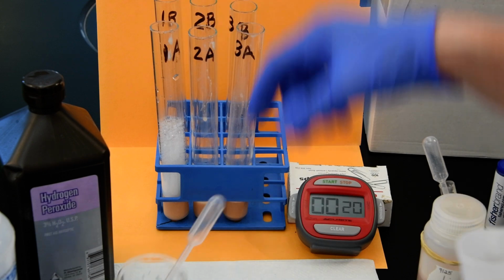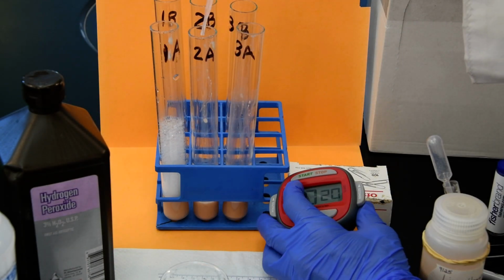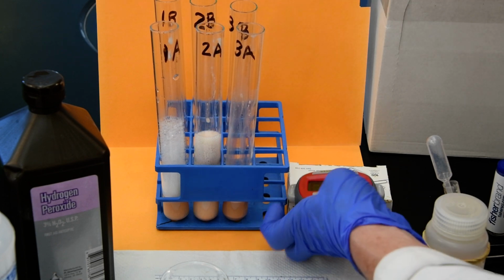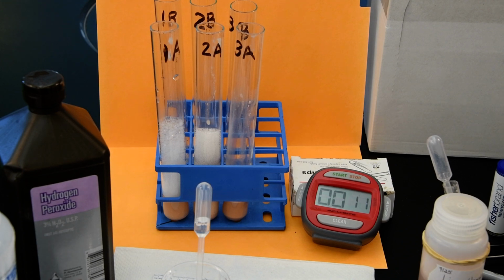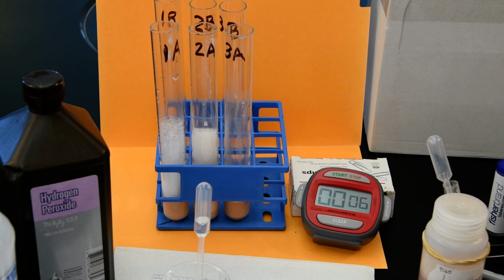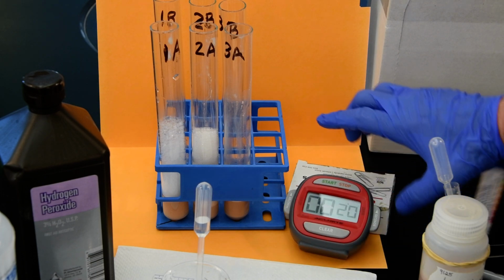2A, which we now have twice as much catalase, allegedly. And this time I'm going to try to hit that at the right time. Okay, ready? Oh, wow. Can't always get what you want. I didn't shake it up enough. Is that what it was? Dang it.